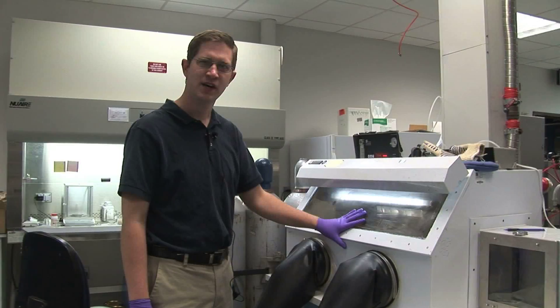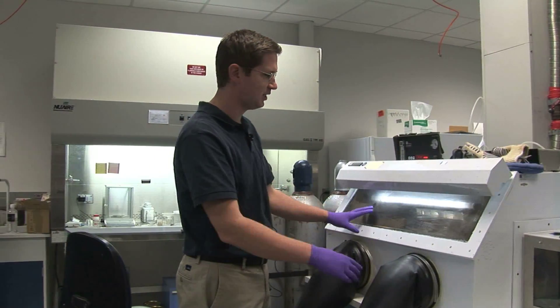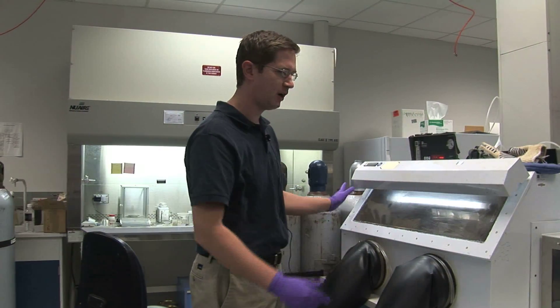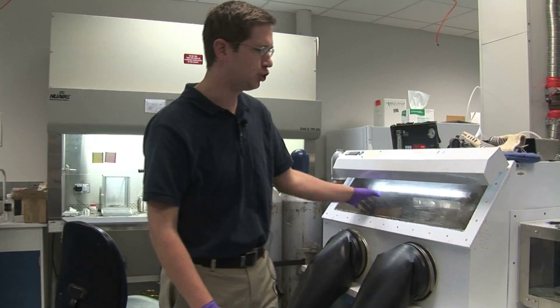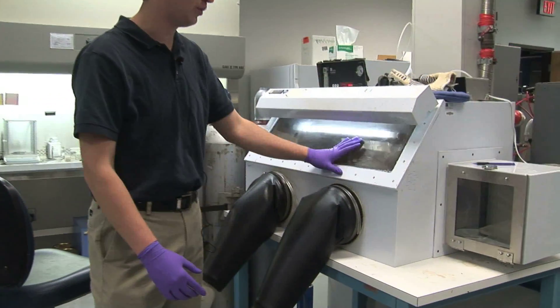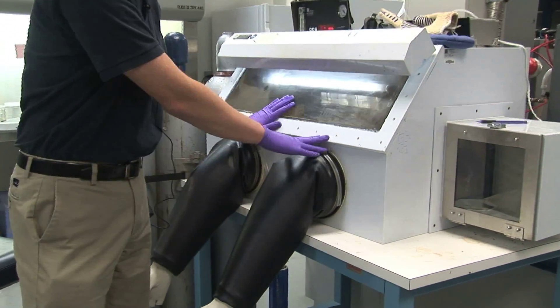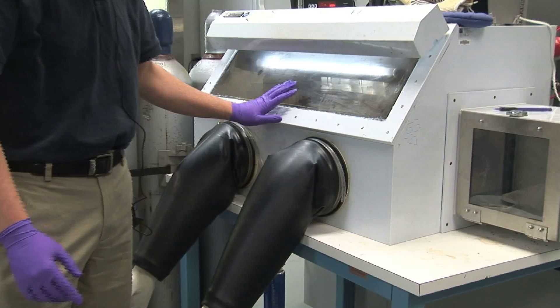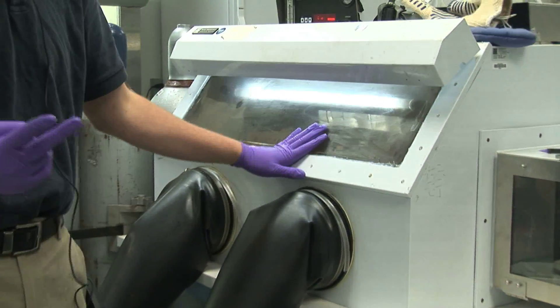This is a glove box. This is a chamber that's sealed off from the environment. We put dry air through it. Whenever we work with acids and nanotubes, we work with it inside a glove box like this.